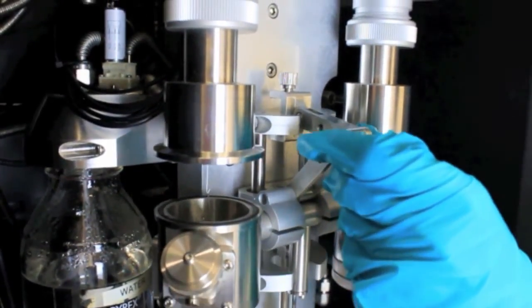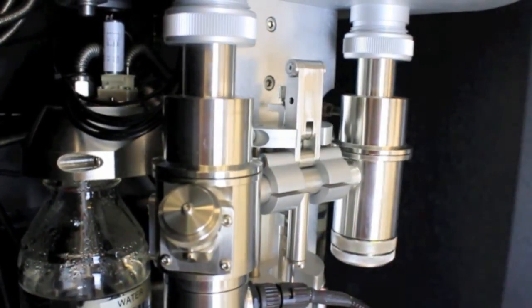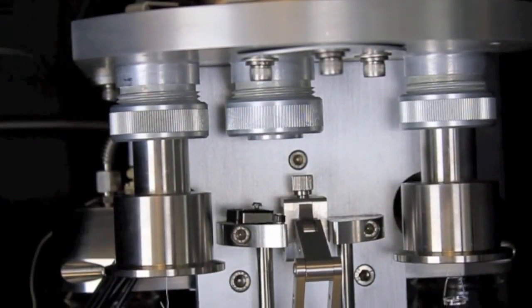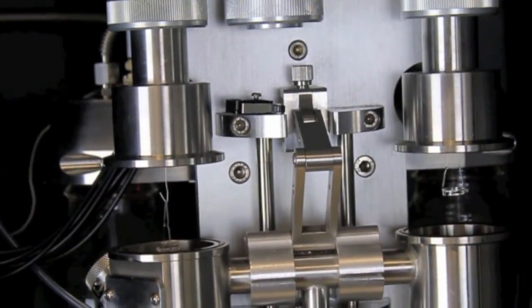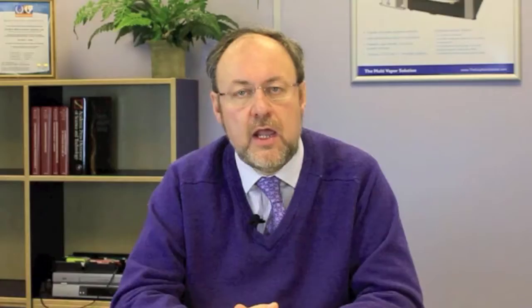We select the humidity and measure the way the mass changes. Sometimes the mass will decrease as the sample gives up water, and sometimes the sample mass will actually increase as the humidity increases. From the amount of water taken up by the sample and the rate at which it takes up, we can learn a lot of information about the way the material is going to behave. The DVS method is an important way for characterizing solid state materials, allowing us to learn more about their properties and performance, helping us in R&D, manufacturing, and product development. It's now used by over a thousand laboratories in industry and academia throughout the world. Thank you.